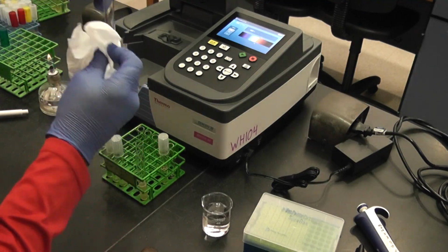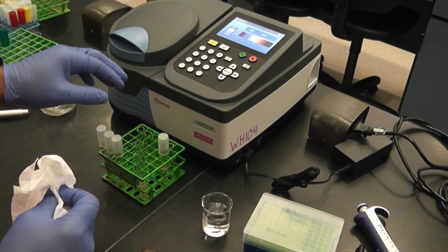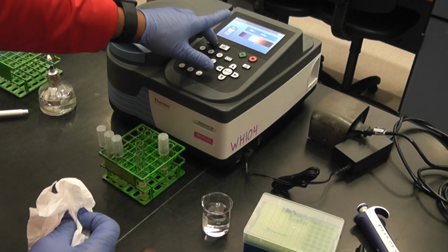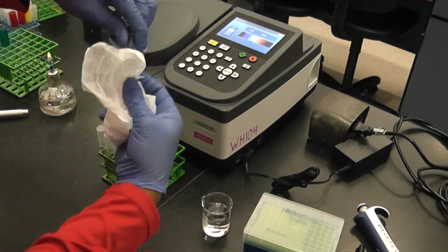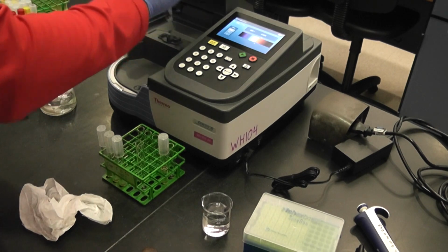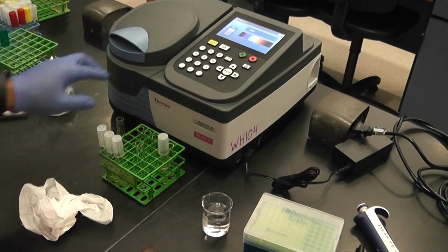Make sure it's zeroed out. It's close, 0.001. It's been blanked. Pull the water out. Put my 24-hour culture in there.